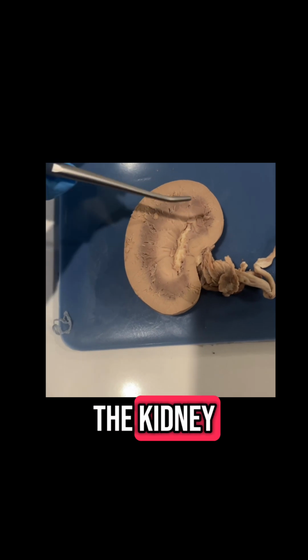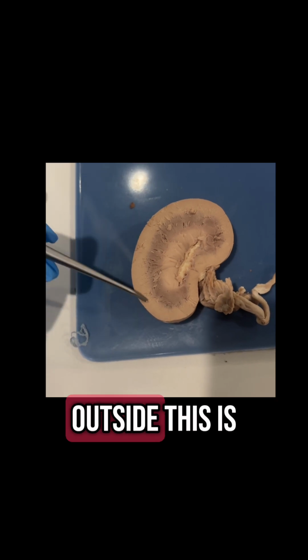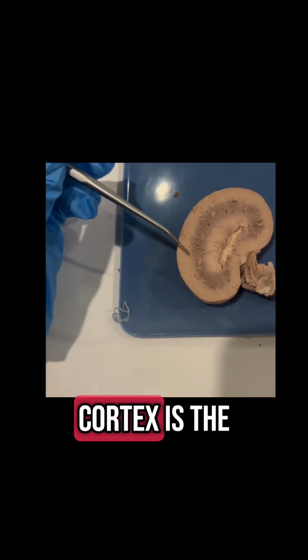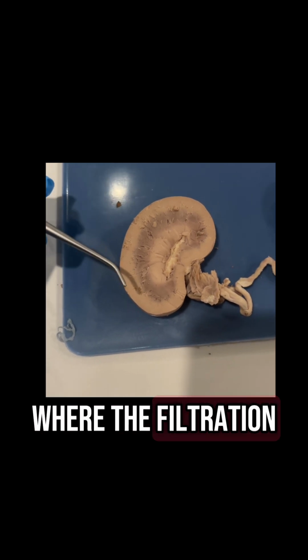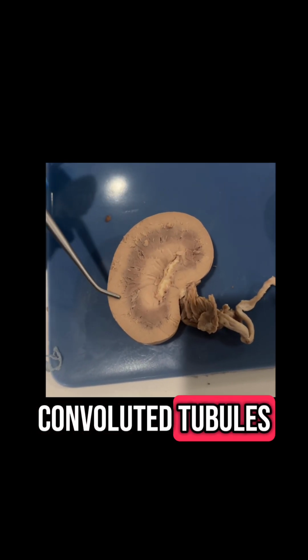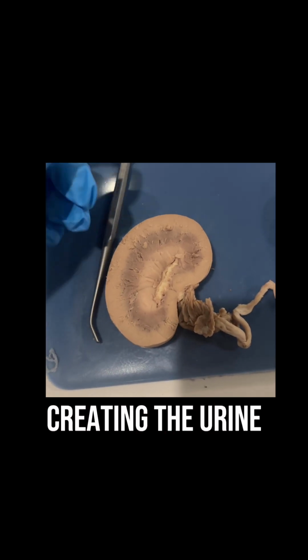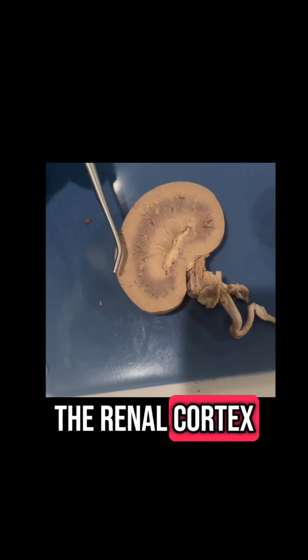Okay, now moving to the inside of the kidney, we've got the renal cortex here. This is the lighter color of the two shades we're seeing here. Right on the outside, this is going to be the renal cortex. The renal cortex is the outer layer of the kidney where the filtration of the blood starts. It contains structures like the renal corpuscles and convoluted tubules. Most of the blood vessels of the kidneys are also found here. And this is where the early steps of creating the urine happen, right here in the renal cortex.